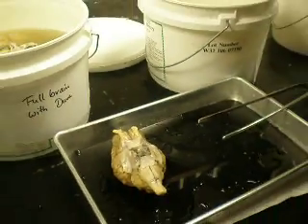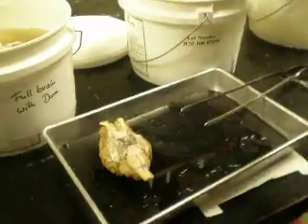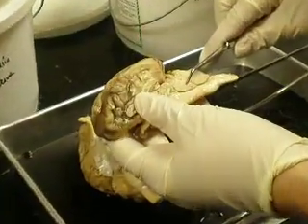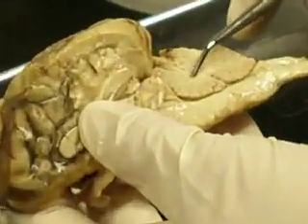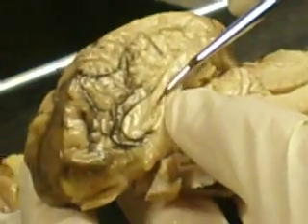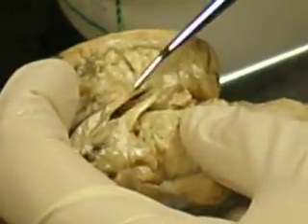Let's get one of these sections. You can see the arbor vitae — the tree of life — right here, and the cerebellum. You can see this space right here is the lateral ventricle.